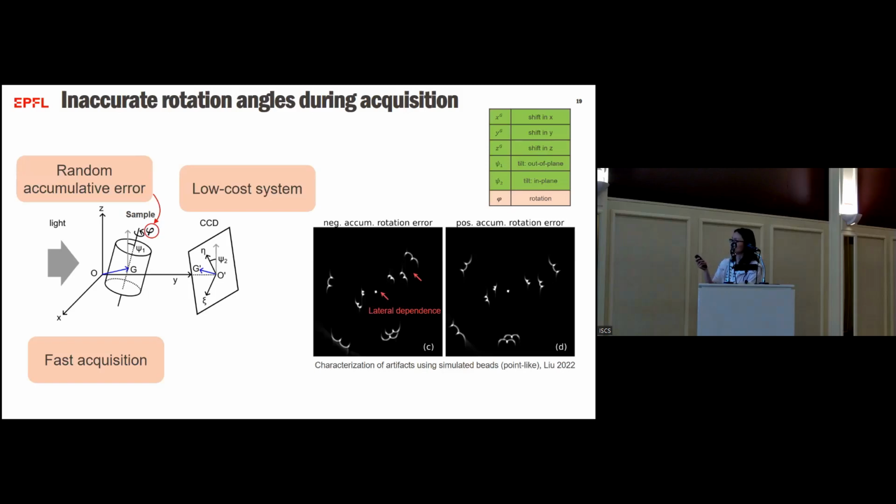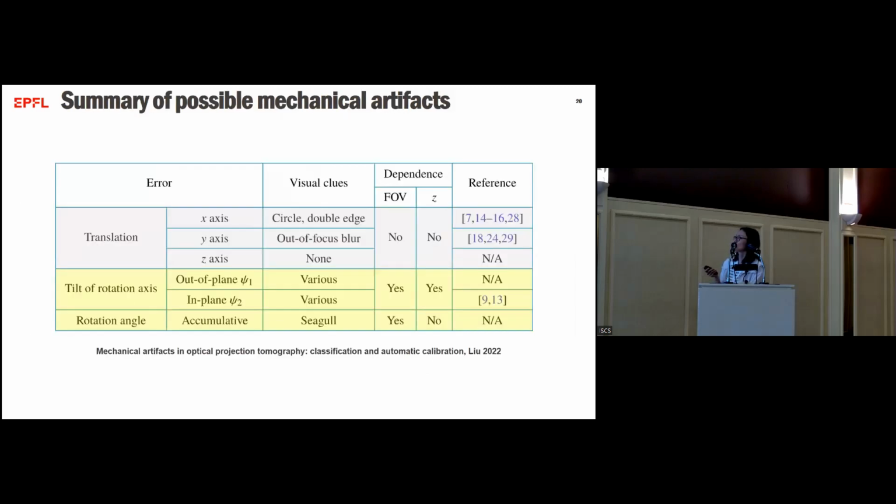They have a dependence on the location in the field of view. And depending on if the error is positive or negative, they have a direction. So either they're flying towards the center or away from the center. Now we have seen all the different types of artifacts. We put them in this table.